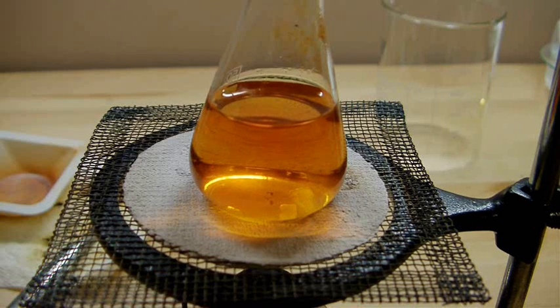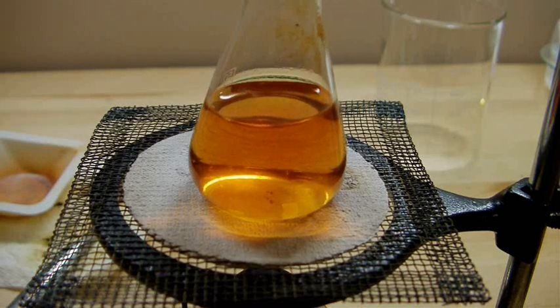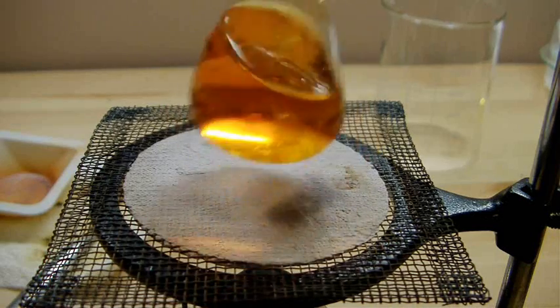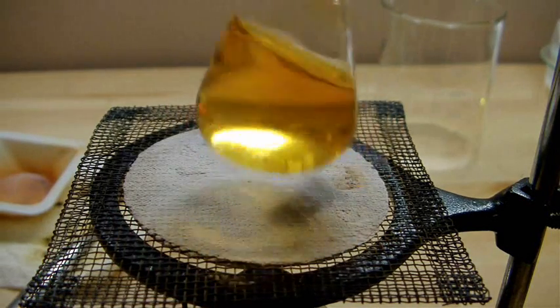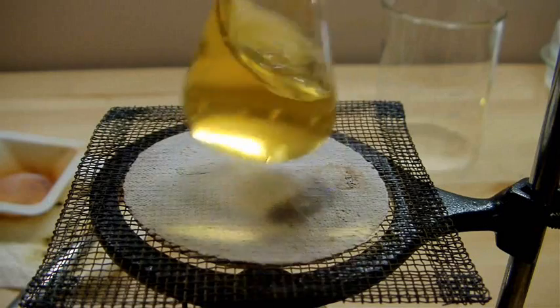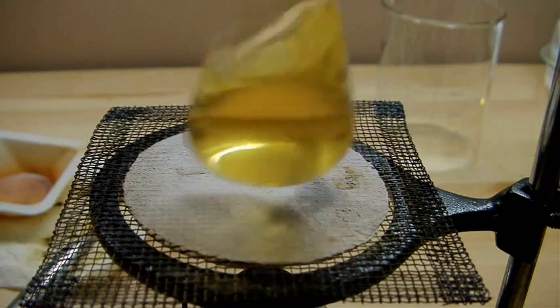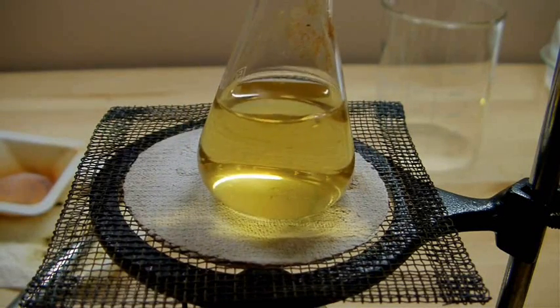And you can hear how exothermic the dissolution is. And you can see as that dissolves, the color clears right up.